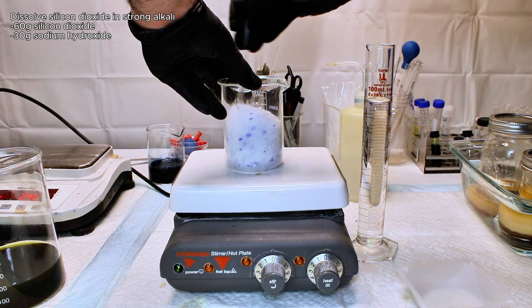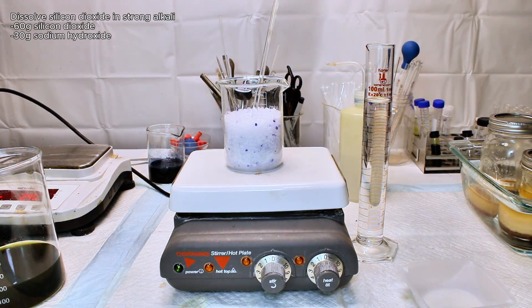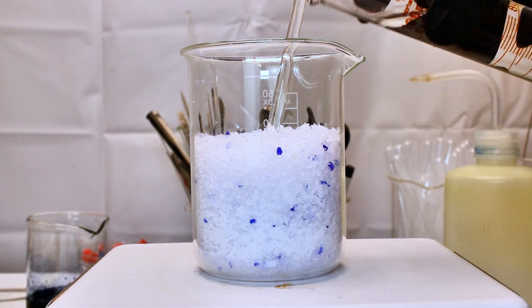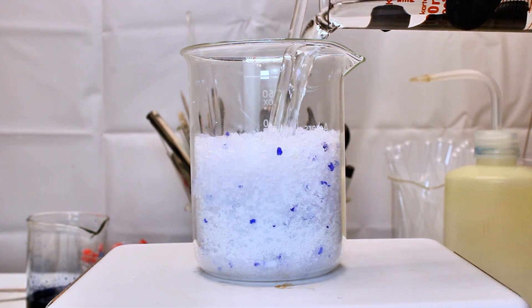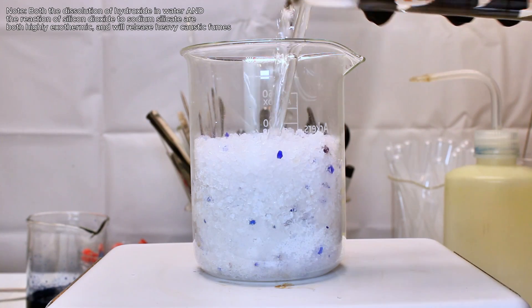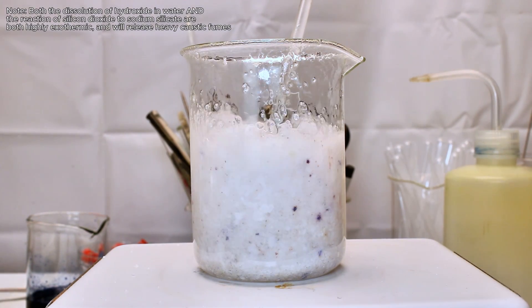To that end, I went ahead and dumped 60 grams of silicon dioxide into a beaker, followed by 30 or so grams of sodium hydroxide. I gave the mixture a little stir, and then added a bit of water which instantly initiated a violent reaction.